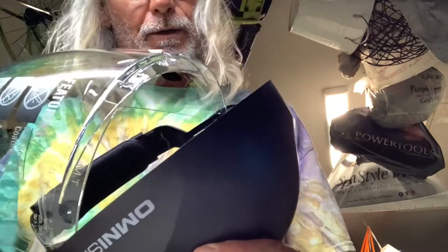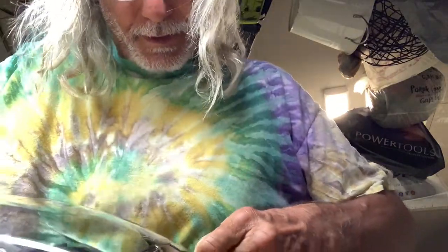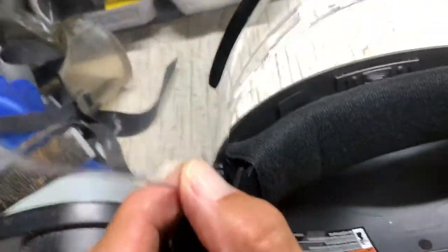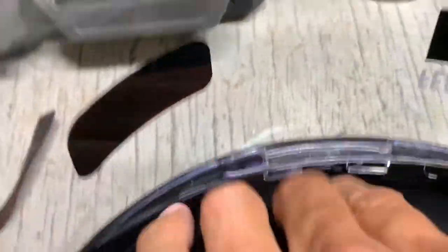Let's go ahead and hook it together. We've got our shield and we're going to twist it on there. We've got to get it on both sides at the same time, which is a little bit of a chore. There it is — I'm going to get it on there. Now I've got it on those little pivot points. You have to pull the mask forward and get each side around that little hole. When it moves this way it's going to slide forward, then we bring it down and pop it in, and it's hooked up. The shield is on there — just make sure those two little things are in there and this part is slid in there.